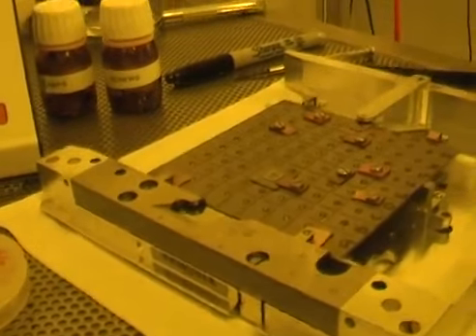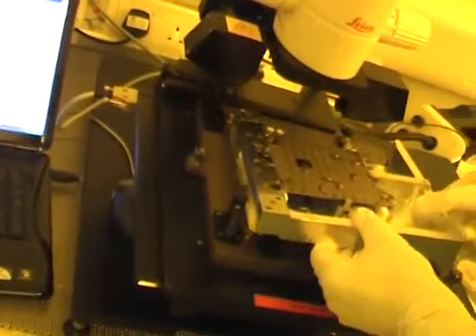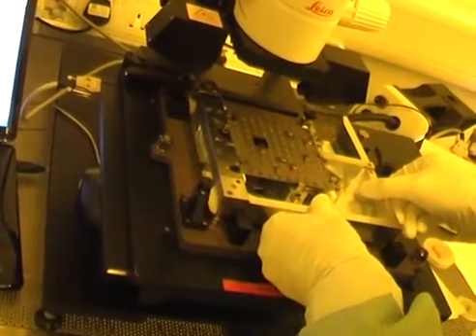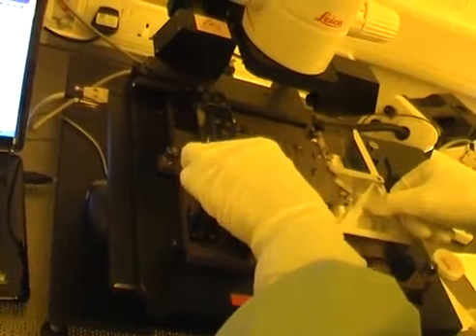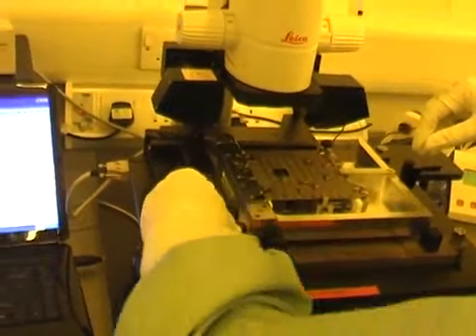Okay, so I've clamped it more securely. We'll see whether that helps in the setting up of the height. So you can see that the operator has a painstaking job here with small samples, that you don't just simply throw them in the machine. They need to be adjusted and readjusted until they're correct.